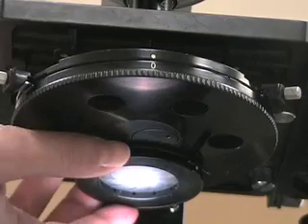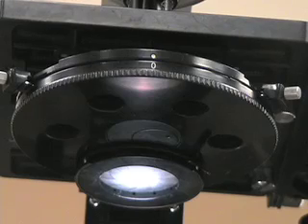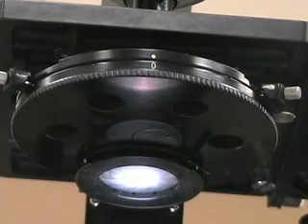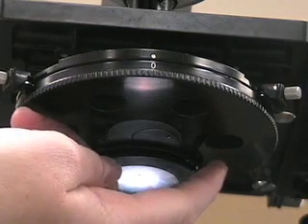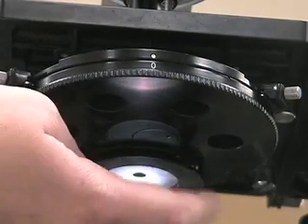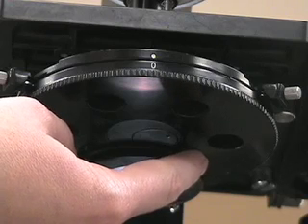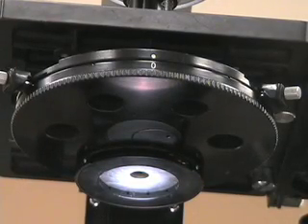Underneath the revolving turret is a small circular piece called the iris, which controls the amount of light shining onto your sample. To adjust the iris, take the lever and turn it all the way to the right, which closes the iris. Then, while looking through the ocular lens, slowly move the lever to the left to increase the amount of light on your specimen. You want to move the lever until the ring of light you see through the ocular lens is as large as the field of view you're looking at.